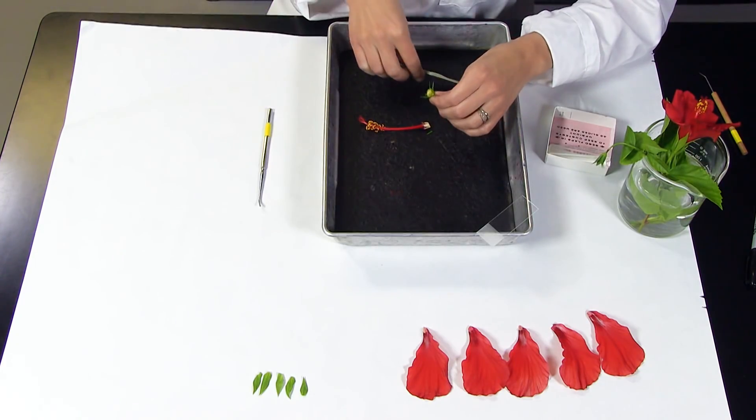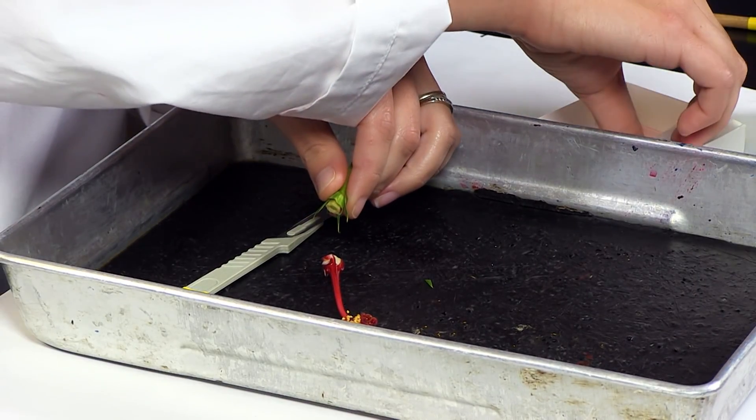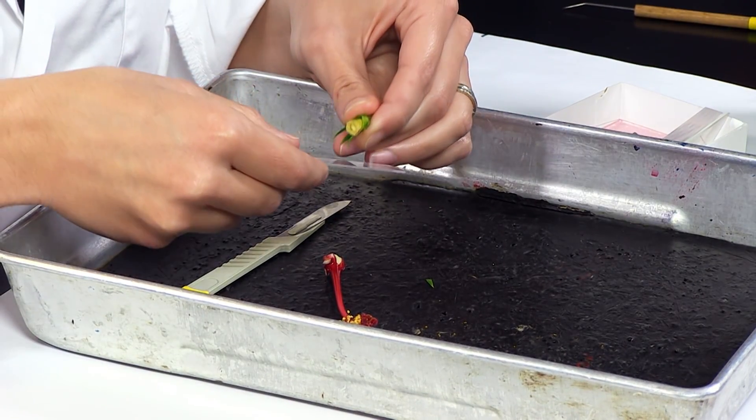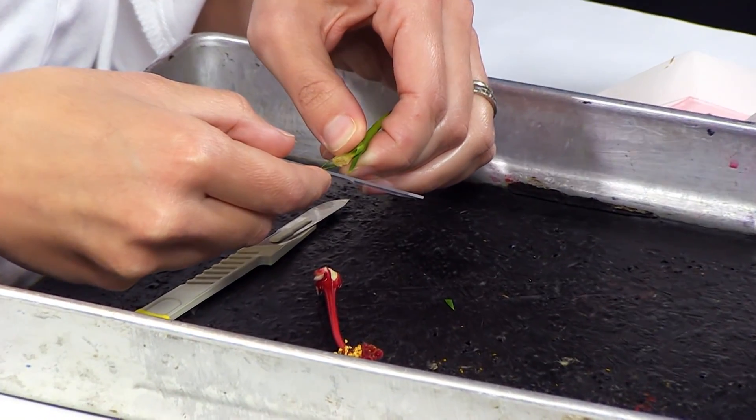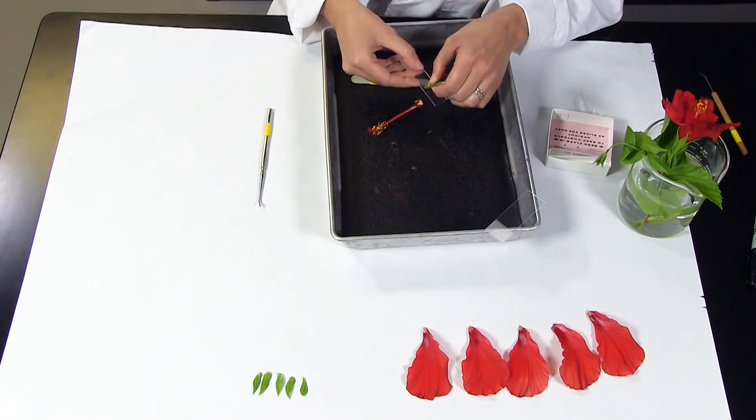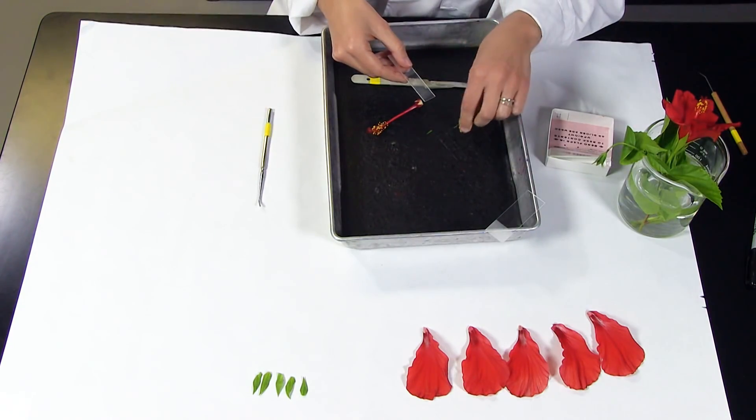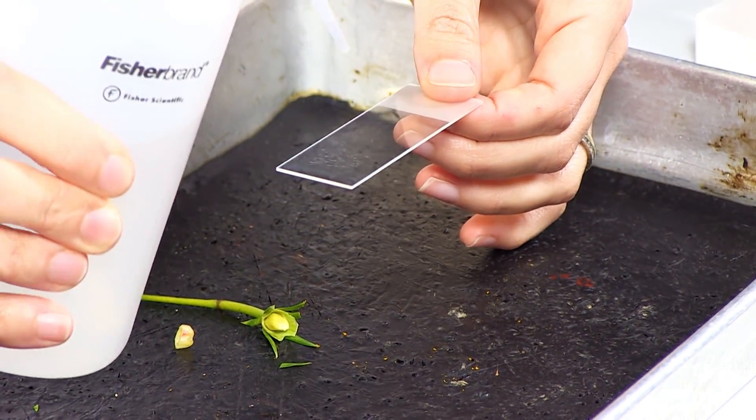With a scalpel or sharp knife, carefully cut the ovary in half. Attempt to squeeze out the ovules. These can be viewed with the naked eye or under the magnifier included in your dissection kit.